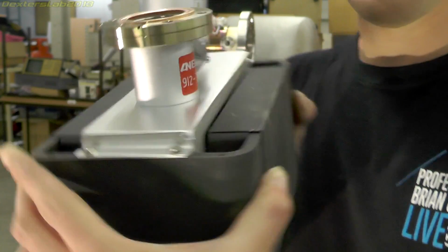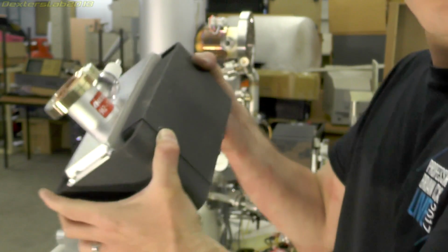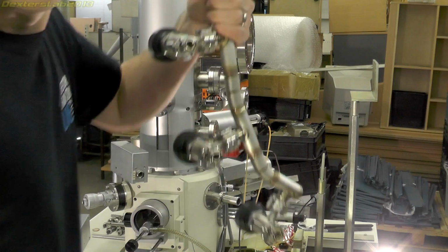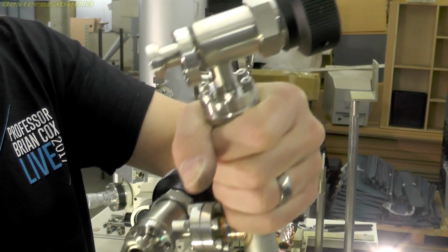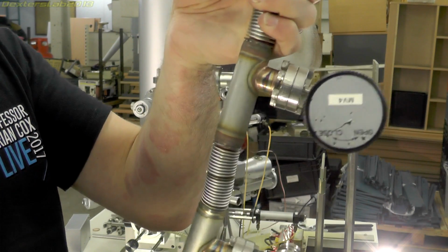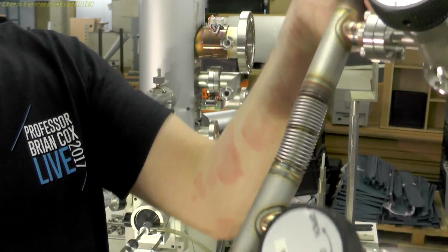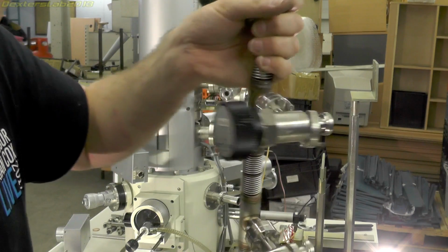And this is one of the smaller ion pumps. So there we have one of the manifold sections, all the valves for the ion pumps. So certainly I'll be keeping that. I'm sure that could be extremely useful to somebody.